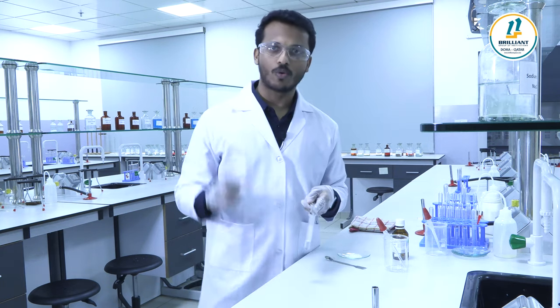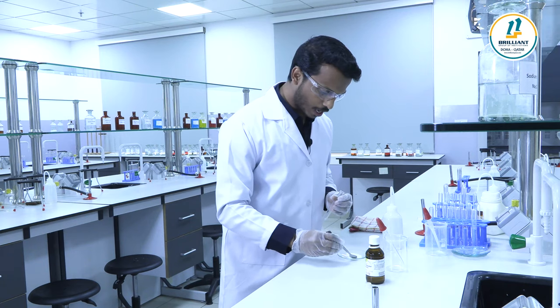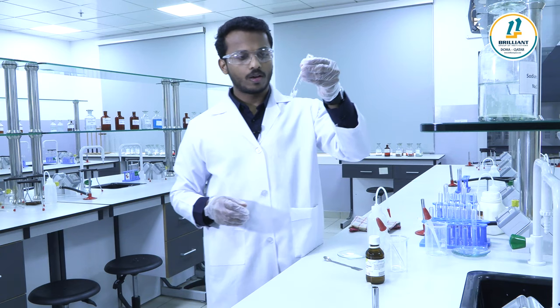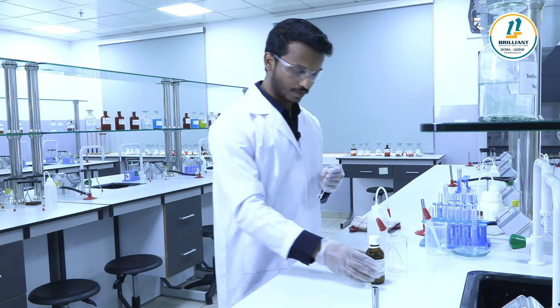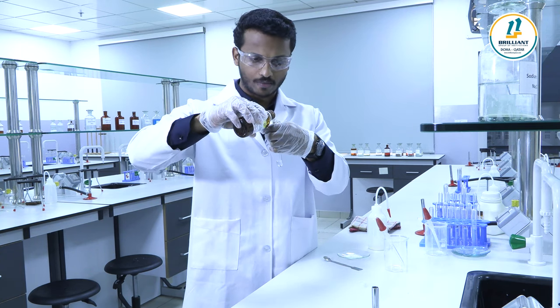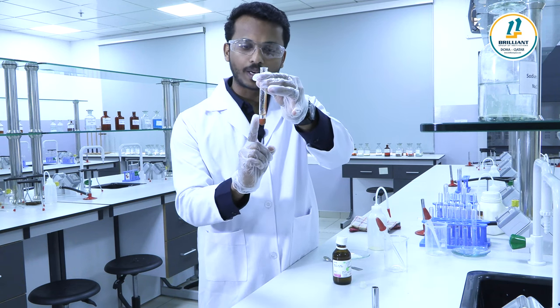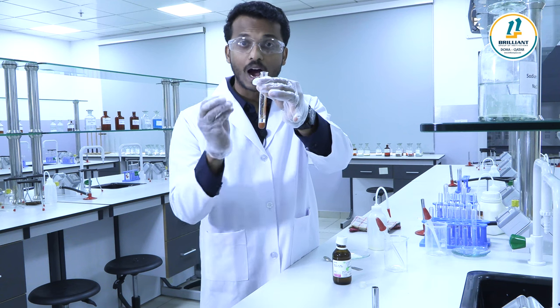Let's go for the second confirmatory test for ammonium cation. Take a pinch of salt, make it a solution by adding distilled water and shaking well. To the salt solution, add Nessler's reagent. You will get a reddish-brown precipitate. If you get a reddish-brown precipitate when treated with Nessler's reagent, it is confirmed that the given salt contains ammonium as the cation.